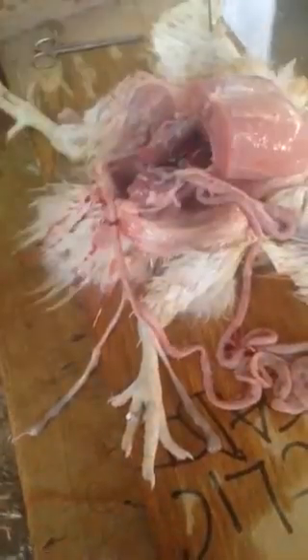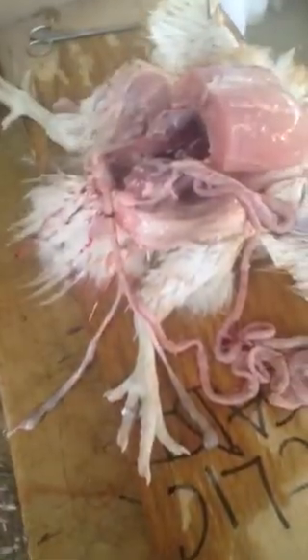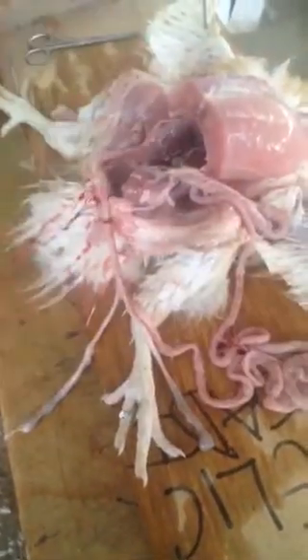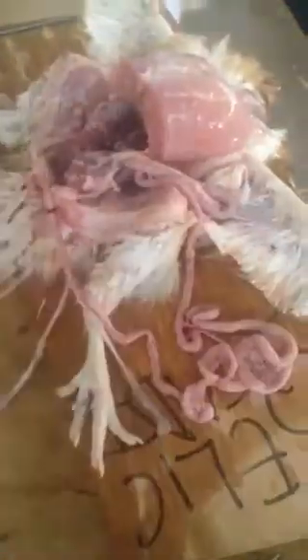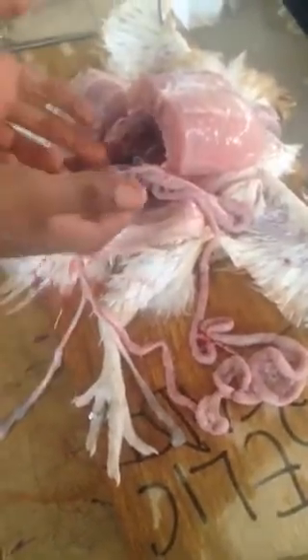But your report now is what you have learned at home in your lab manual. Whatever we do here in dissection is for the examiner to say that you have dissected. For example, if they ask you, display this organism to show the digestive system, this is what you do. The diverticuli is there. They have seen the small intestine with what? Mesenteries you have labeled. They come here, they see what? The duodenum. From the duodenum, they see the pancreas. The crop is there. The gizzard is there.